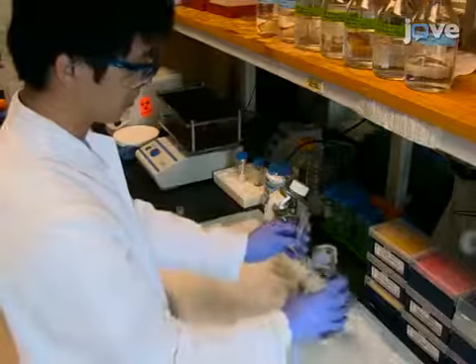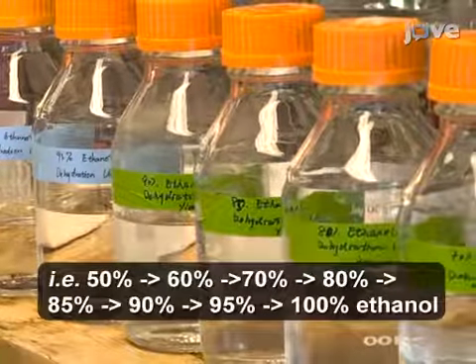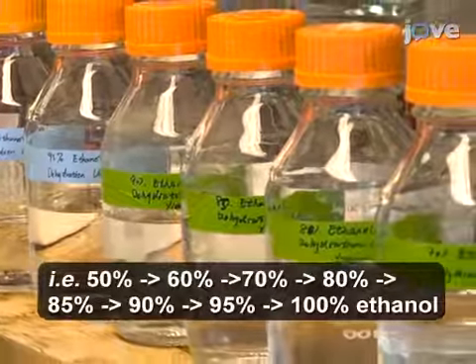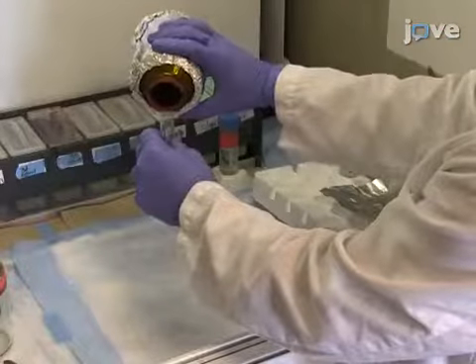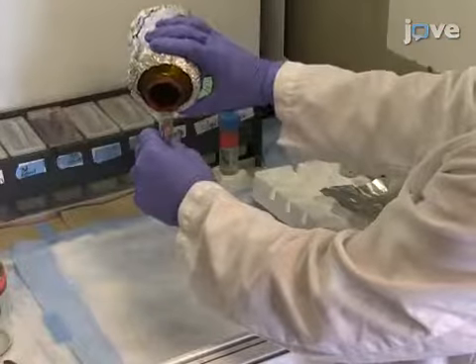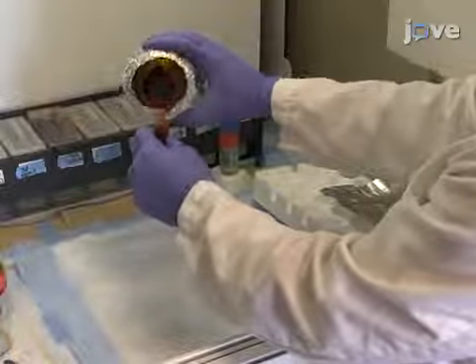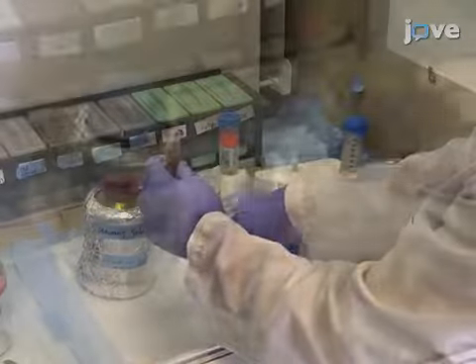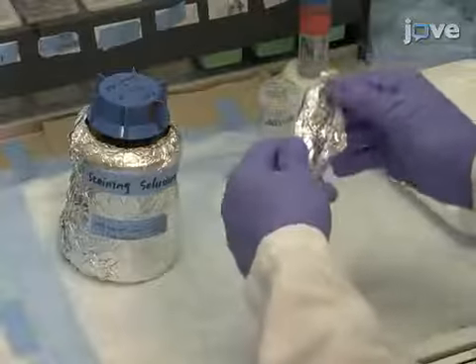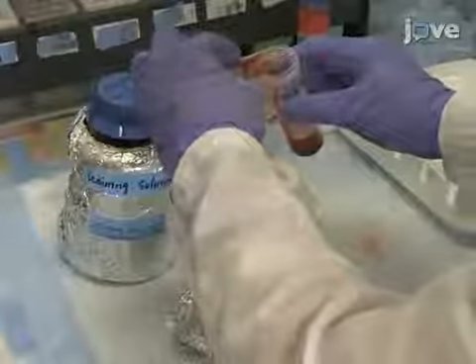Then dehydrate the samples in an ascending ethanol series at room temperature on a gentle rocker for two hours for each concentration. After the 100% ethanol dehydration, transfer the specimen to staining solution for one hour protected from light. Then replace the solution with fresh staining solution for overnight labeling of the specimen.